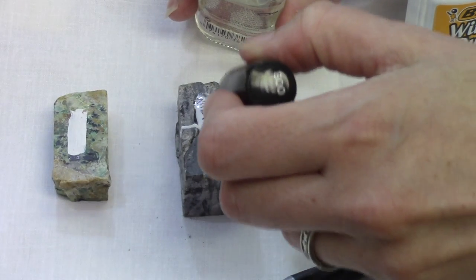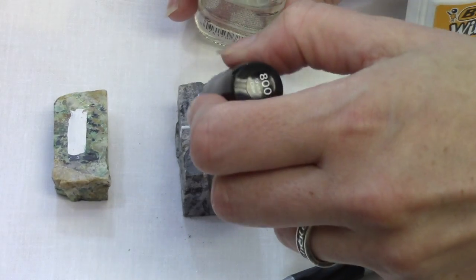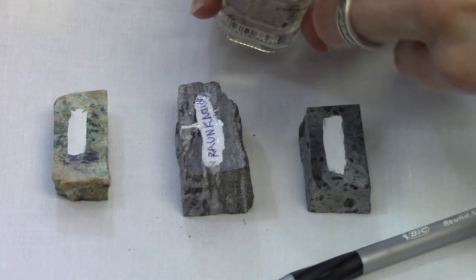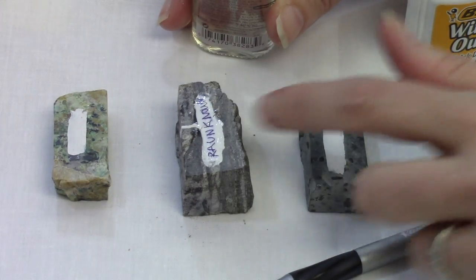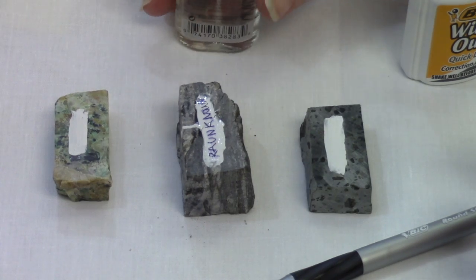This is where it becomes important to not have a pen that will bleed easily, because you can already see it get smudged a bit from the polish.